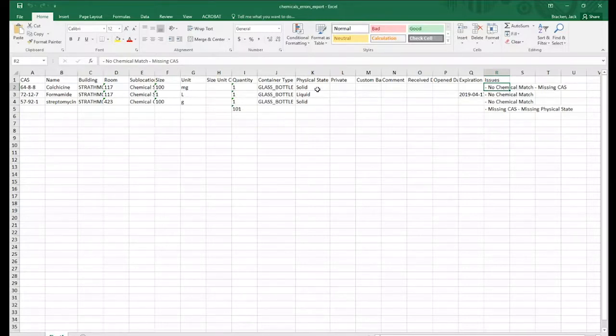If you use the spreadsheet correctly and utilize the drop downs instead of typing in your own units, physical state, or container types, there shouldn't be much of a problem. However, let's just go through each item individually and see what the issue might be.